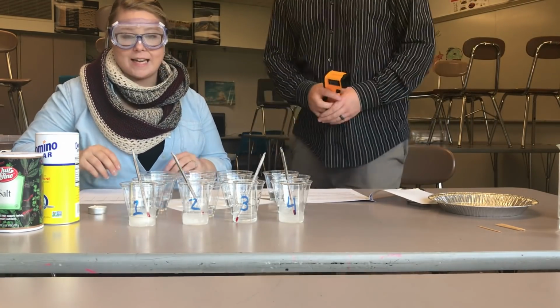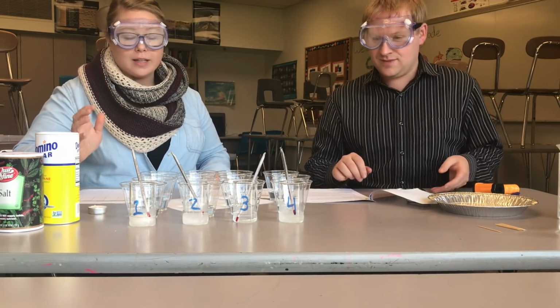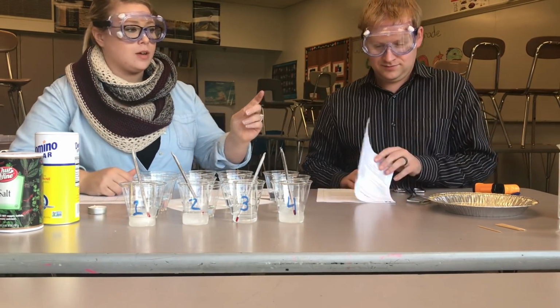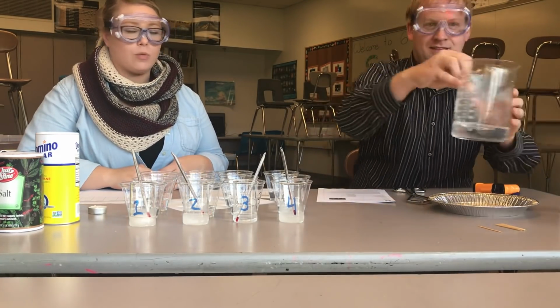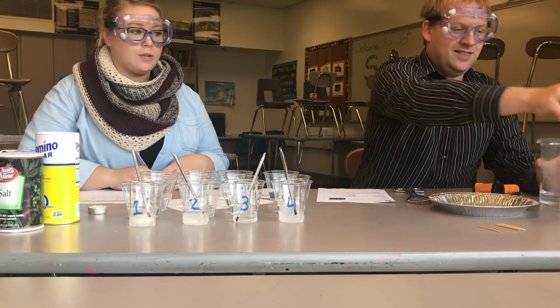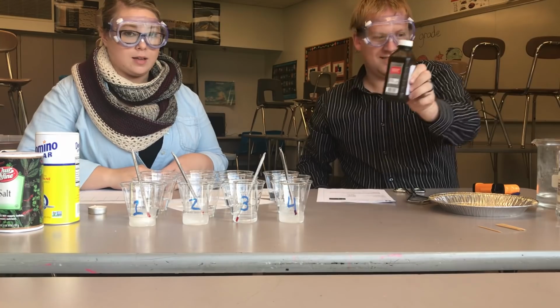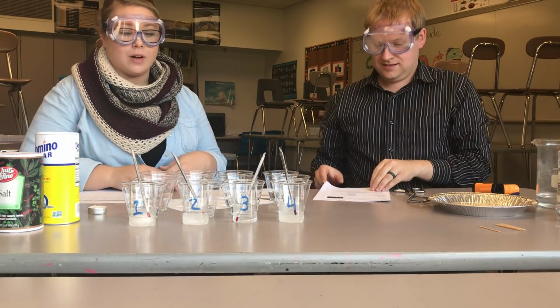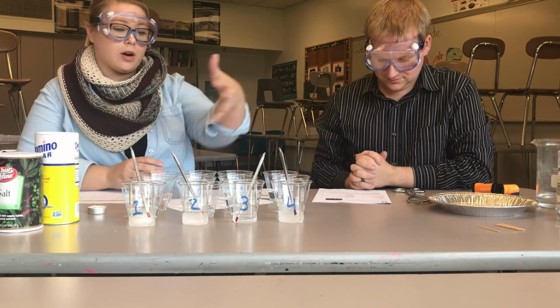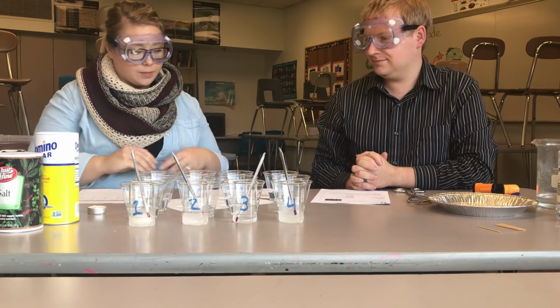So this is the Identifying Liquids Lab. And we have 4 clear liquids we're starting off with. We have alcohol, we have water, vinegar, and hydrogen peroxide. And we are going to do some different tests to find out what each of these 4 liquids are that we have in the cups here. So which one goes to which of those liquids.